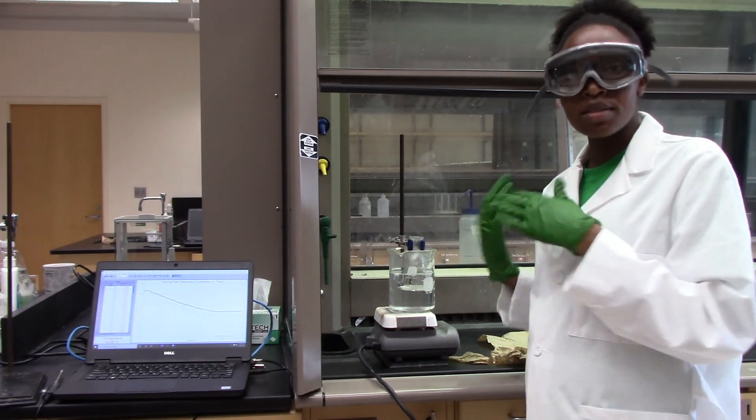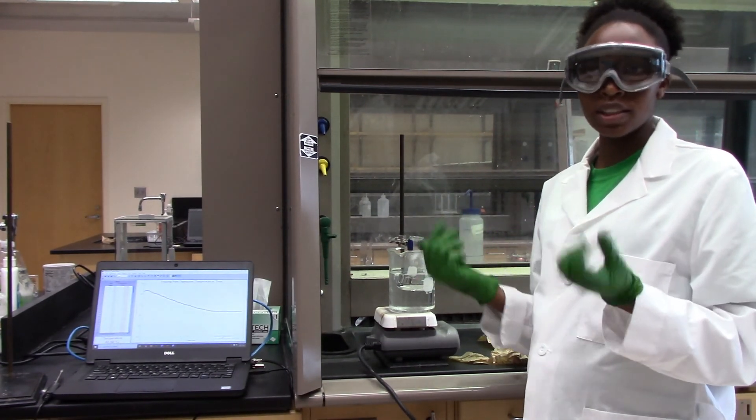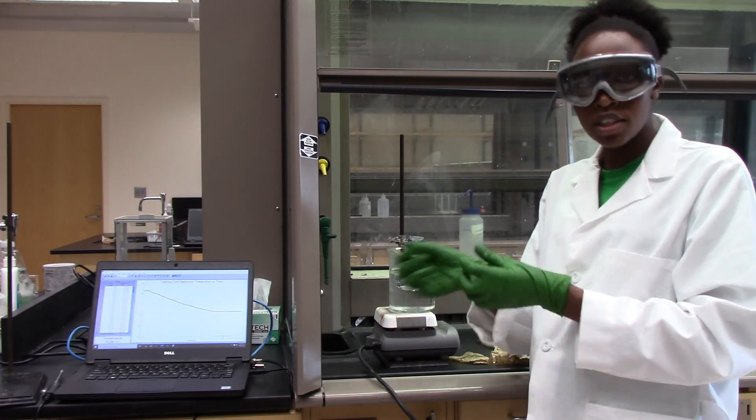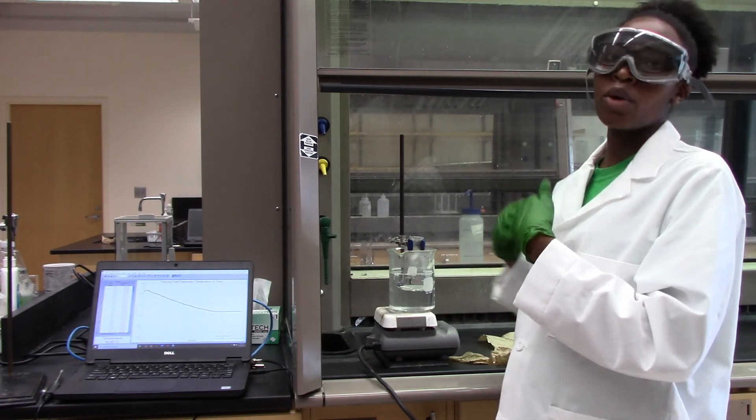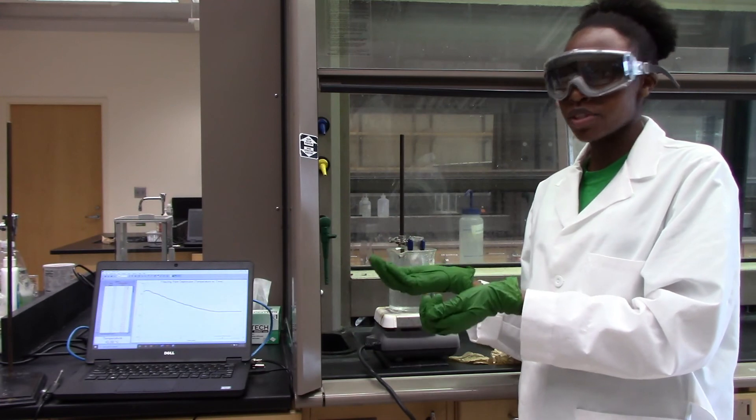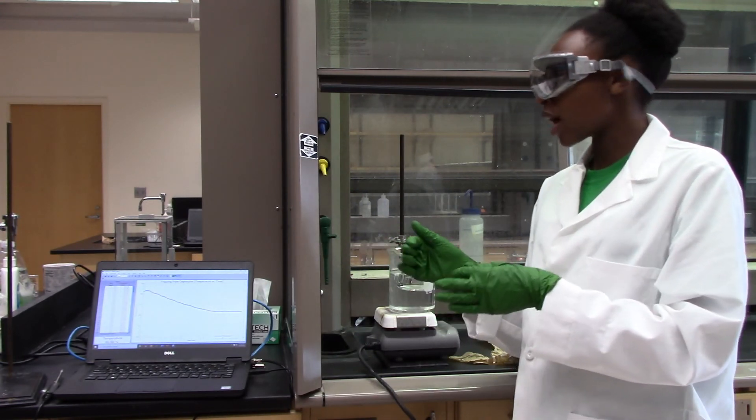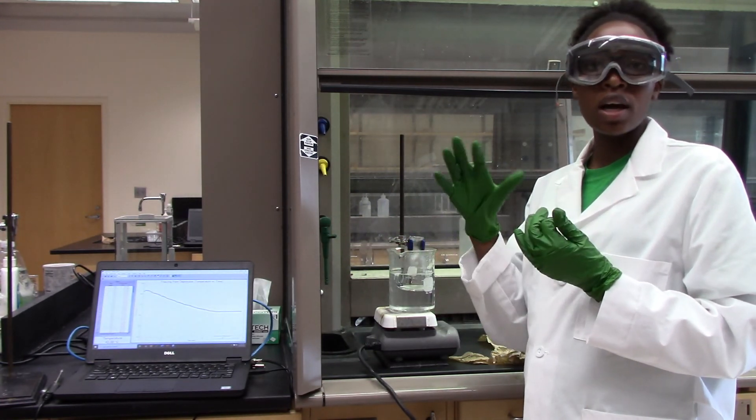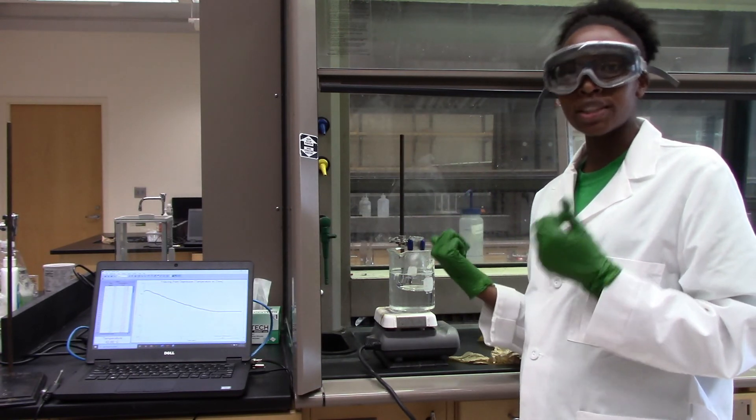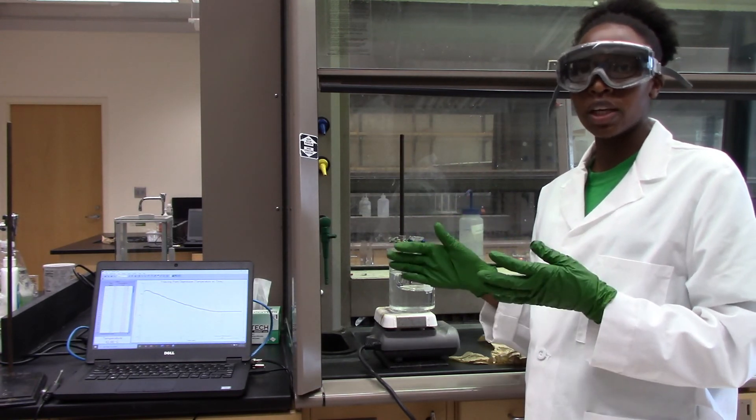Okay, so once it's back into the liquid, I'll also take the temperature, make sure it's about 60 degrees Celsius, and then I will repeat the same procedure, and I'll show you how the cooling curve for lauric acid plus unknown number one will look like.